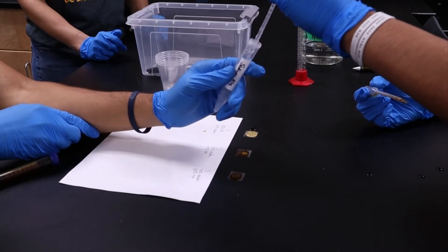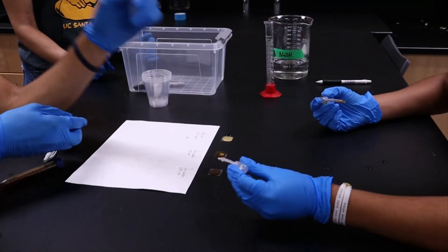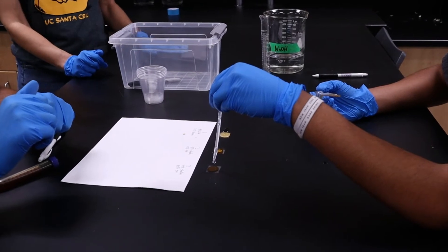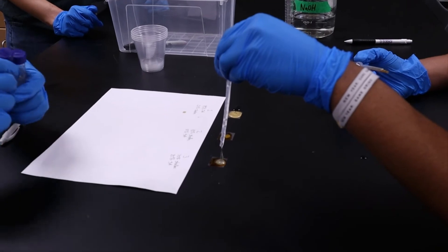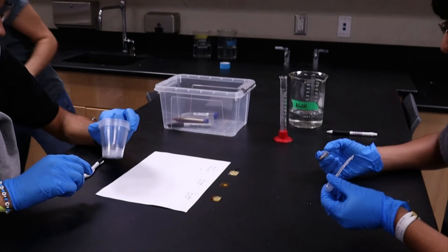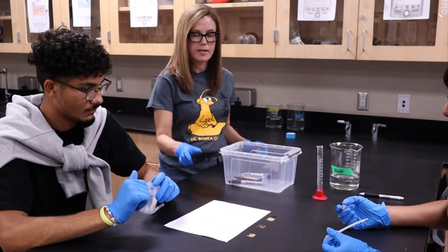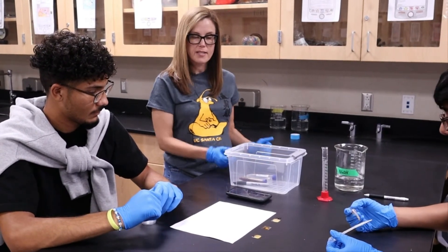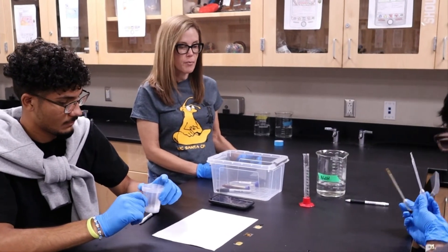You're able to pick your own percentages and ratios, but remember that when we did 50/50, our coating started dissolving before five minutes and that wouldn't hit the target for what we're looking for. Now we're going to set the timer for five minutes to let them dry. If you have a longer amount of time, you can leave it longer. You can throw away your pipettes and then we'll be setting up our cups.